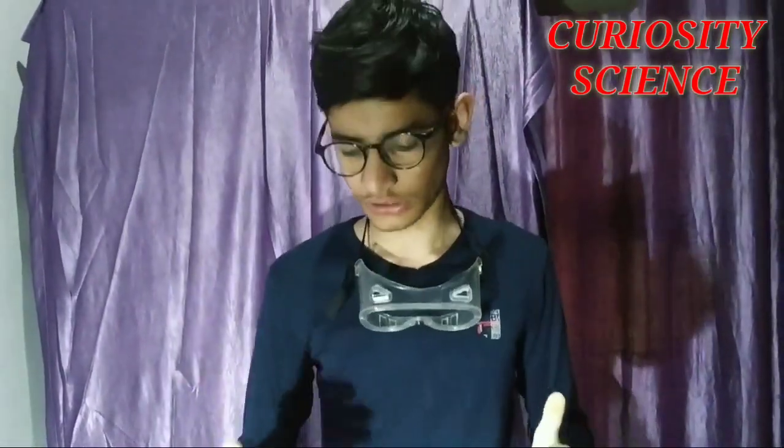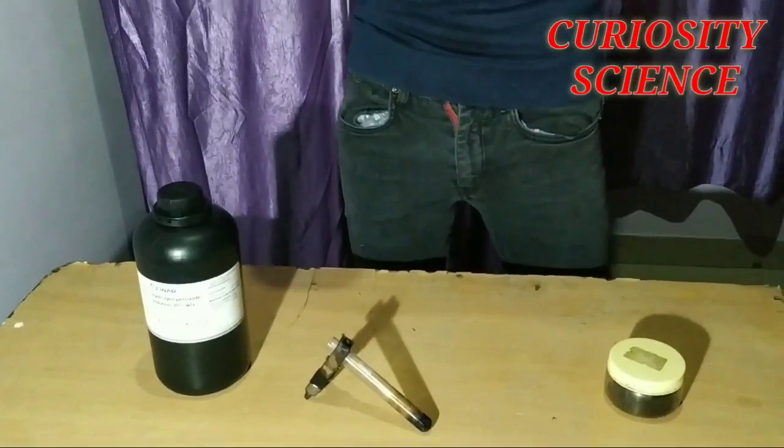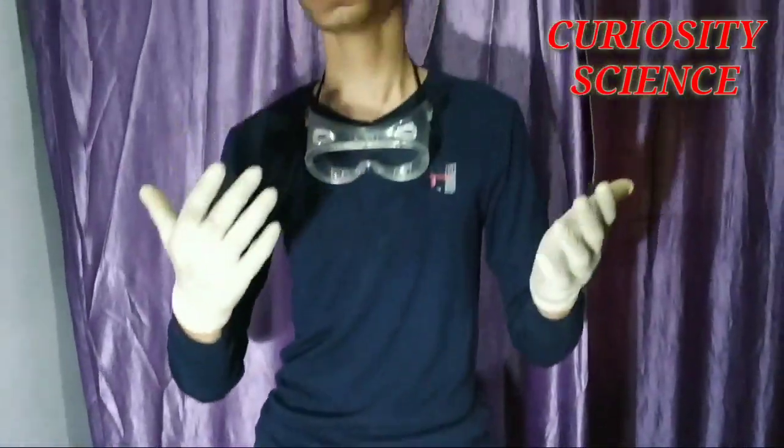You can see how much steam is coming out — not smoke, but steam — because so much heat is generated in the reaction that the water evaporates. We can see it is boiling, and a lot of oxygen is being released. It keeps boiling and the oxygen comes out. This is what happens when you combine potassium permanganate and hydrogen peroxide.